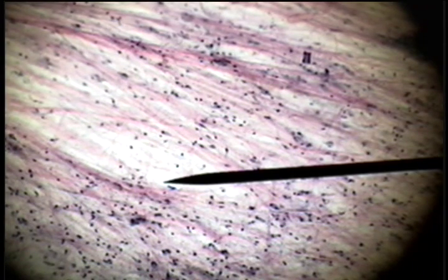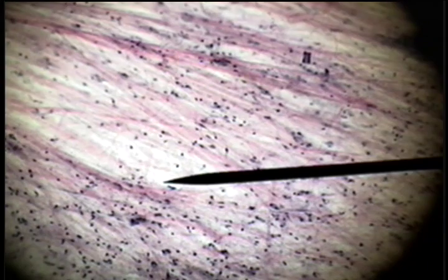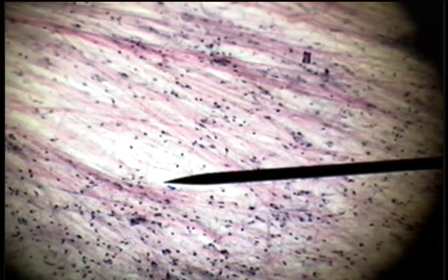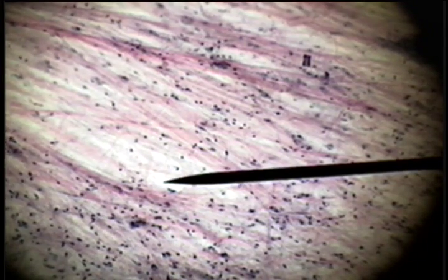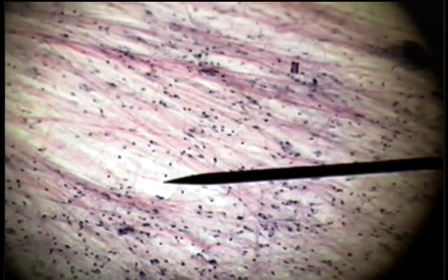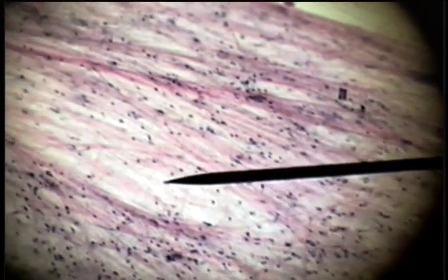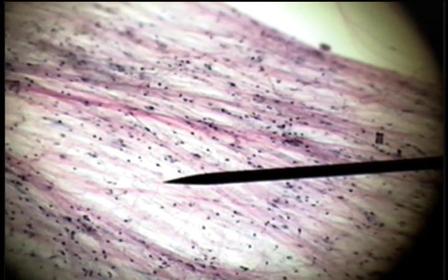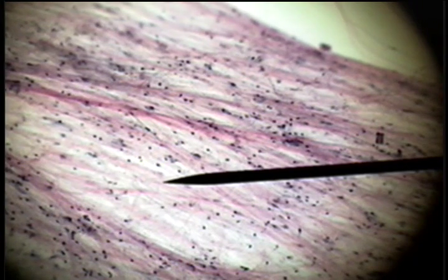This slide shows loose areolar connective tissue. Connective tissue has three basic components: ground substance, shown here in white; the cells, the dark structures; and fibers. There are two fiber types in this loose areolar connective tissue.